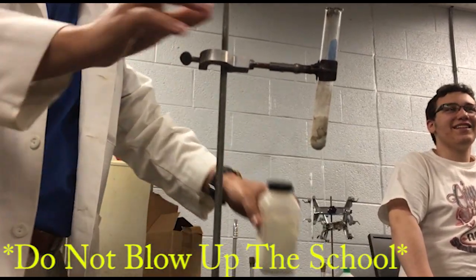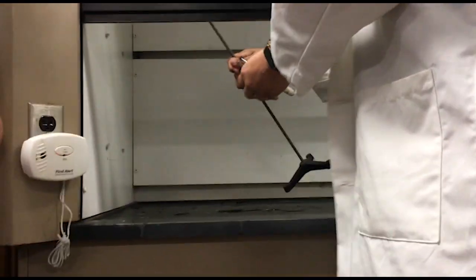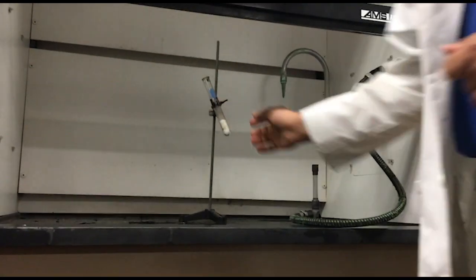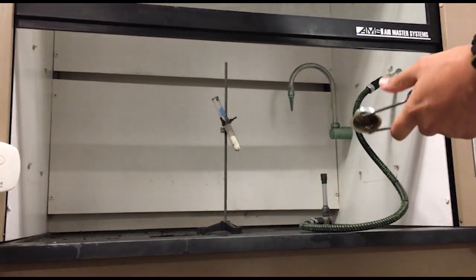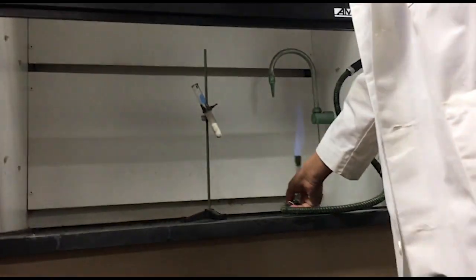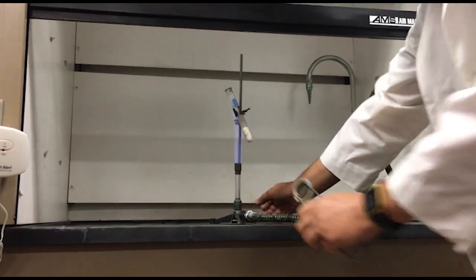Now, watch this. No. Put this in the fume hood. If you need to move around to see a little bit better, that's okay. Make sure everyone can see. I want everybody to be able to see this. I'm going to take my gas line and we're gonna light this. And this is the slow part. This is going to take a few minutes.